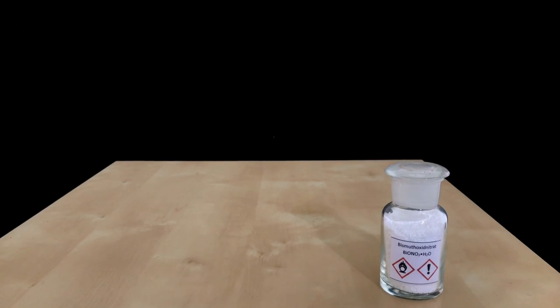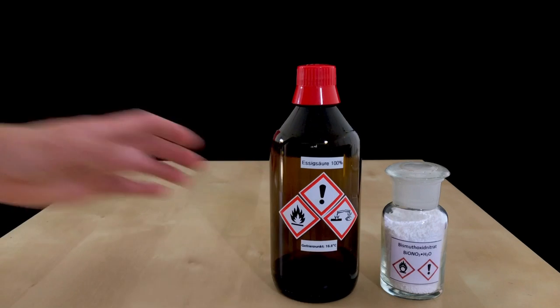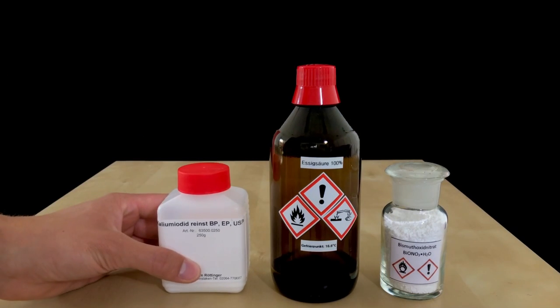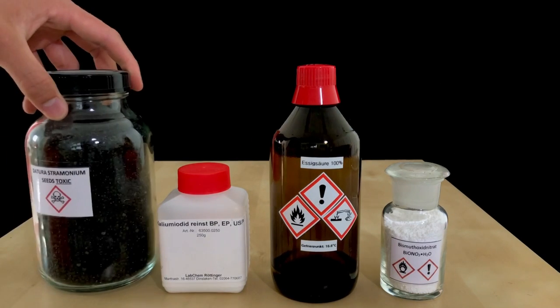Of course we are going to need a few chemicals for this. We are going to use 0.17 grams of bismuth oxynitrate, 22 milliliters of glacial acetic acid, 4 grams of potassium iodide, and some distilled water.